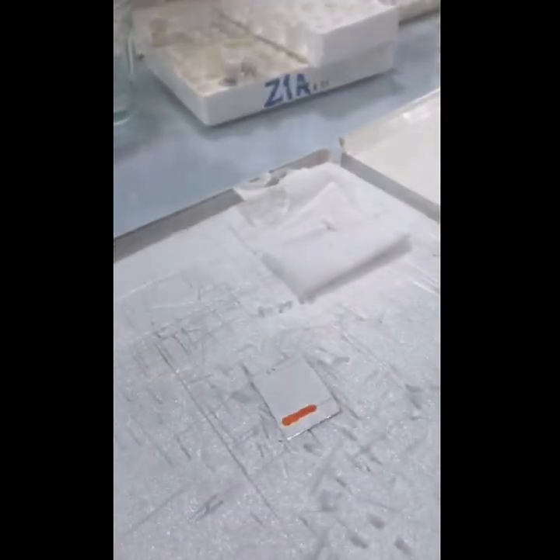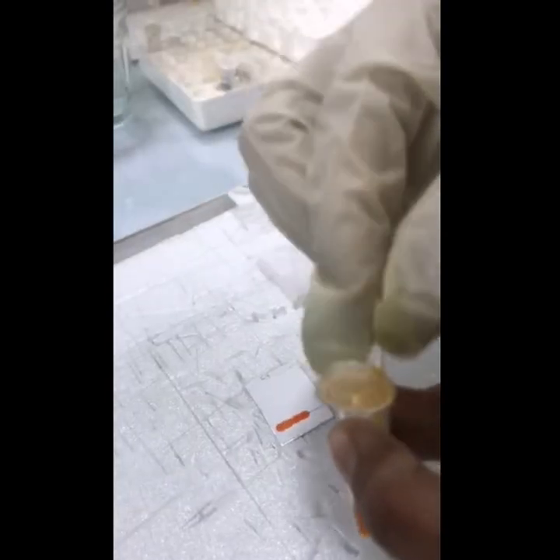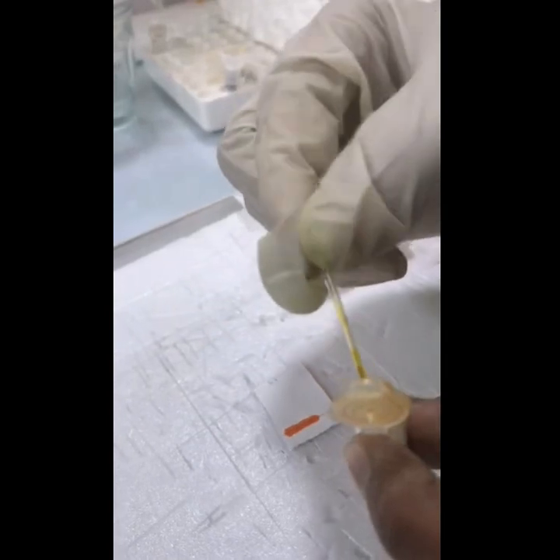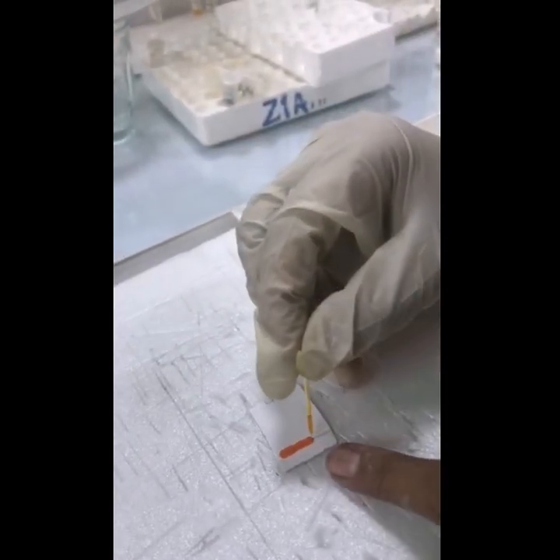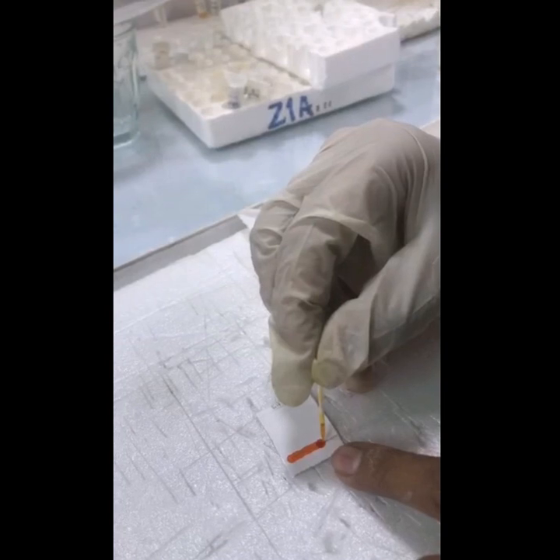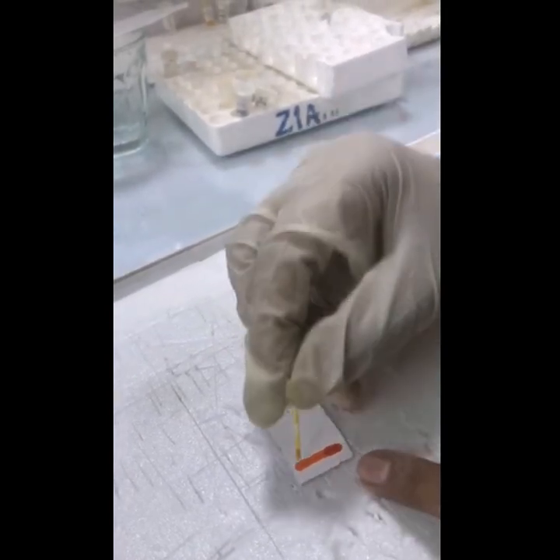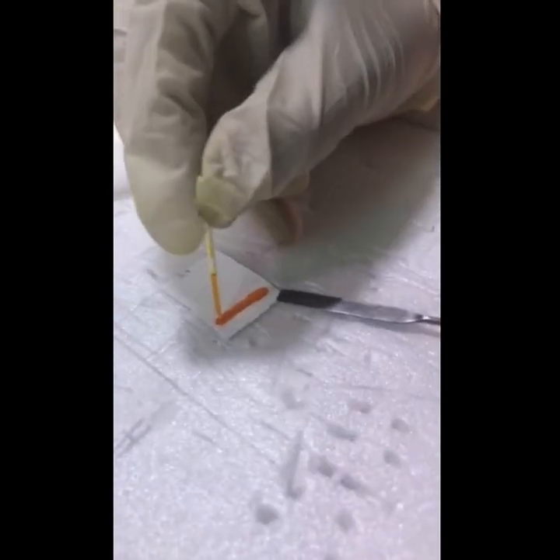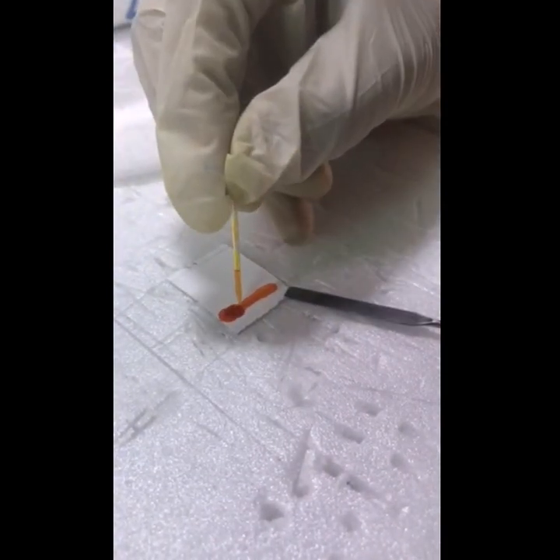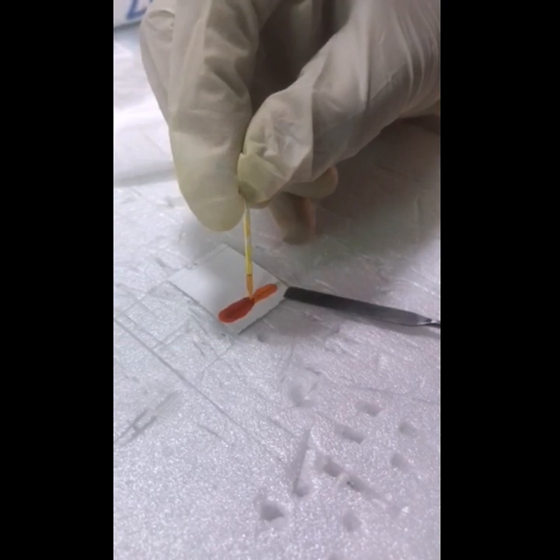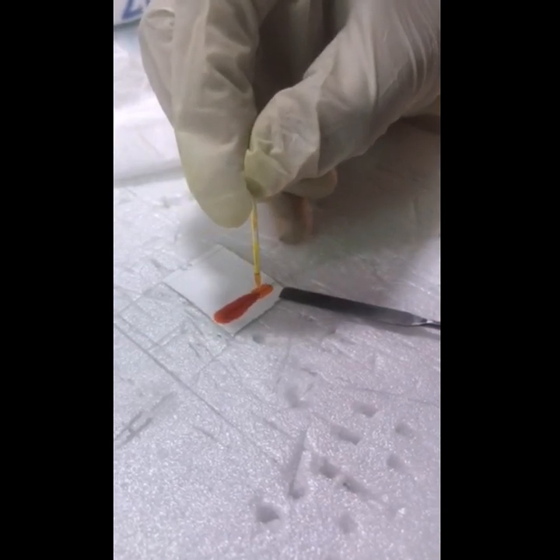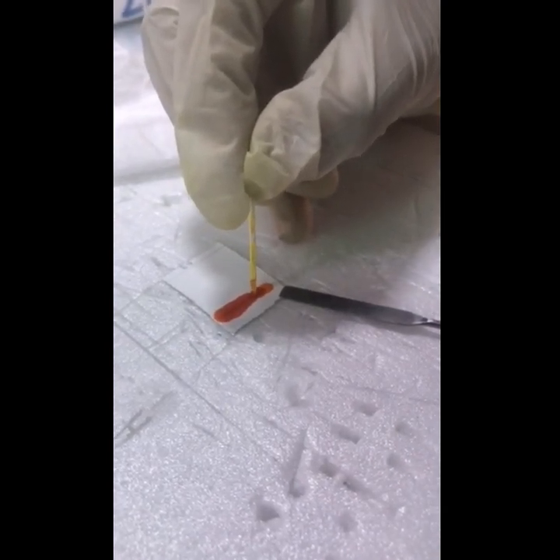Then I placed this TLC in the TLC jar or TLC tank, whichever is available. I loaded it again to make it concentrated and to ensure all my sample was loaded on it.